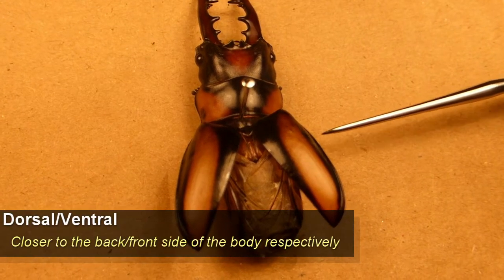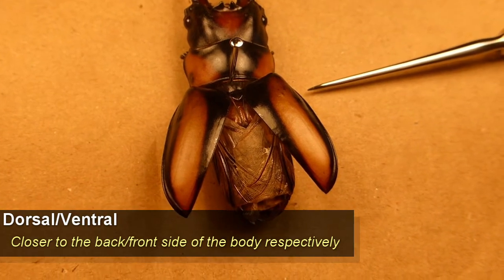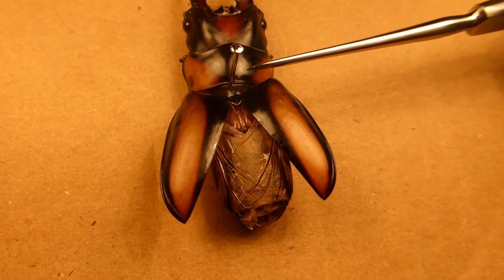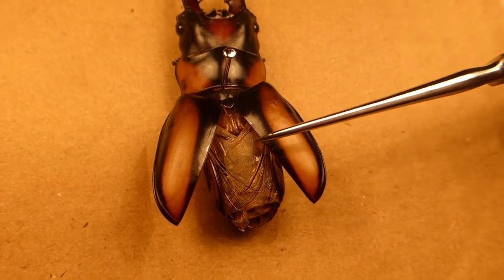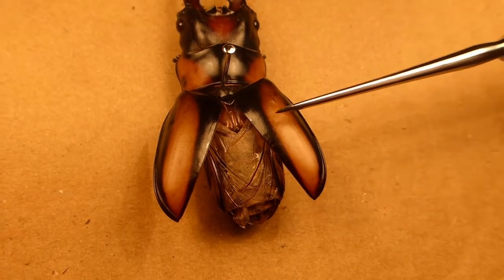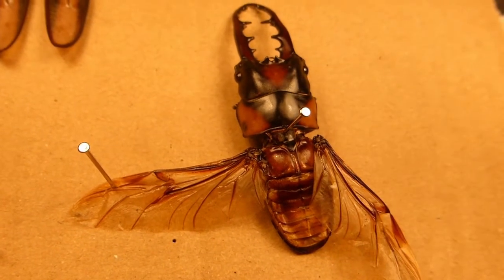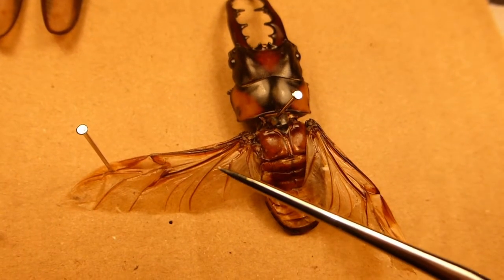I've now pinned the beetle down onto its ventral side, so its dorsal side — its back — is facing upwards. I've also opened these elytra up. You can see they attach here; this is the primary pair of wing attachments for the first pair of wings. These are the hardened elytra shells, and you can see the delicate flight wings underneath. I'm now going to remove these elytra and show you the flight wings in more detail. So I've removed the elytra, which I've pinned down over here, and exposed the flight wings with one pinned out so you can see the scale.